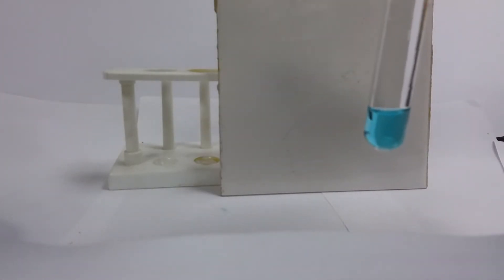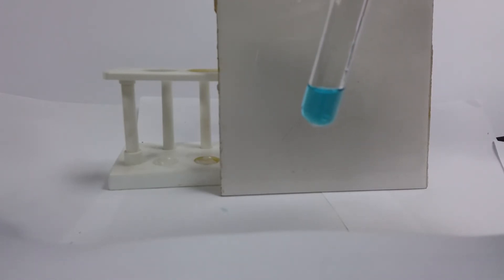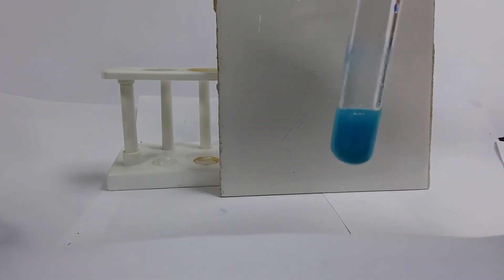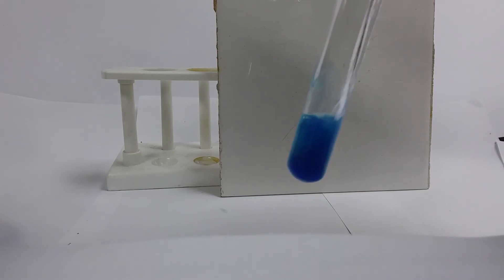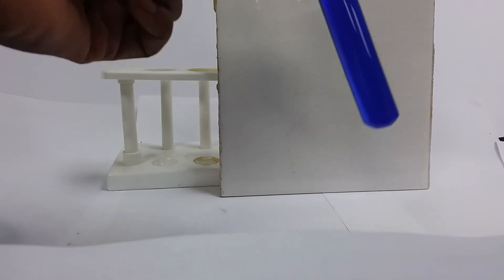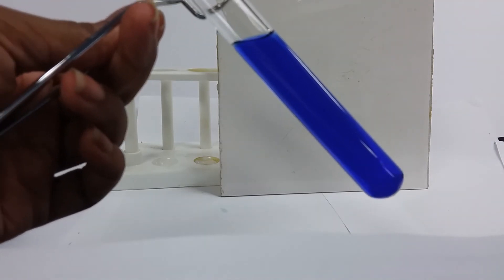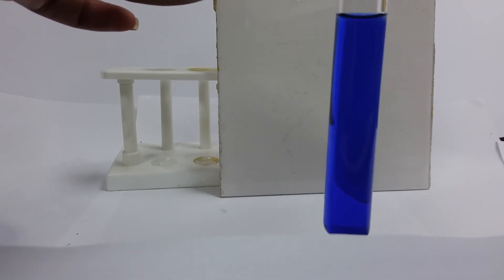Next up, some aqueous ammonia. What do you expect to see? What you're seeing is a lot darker than what I'm seeing in real life — remember what it looked like at the start. That was one or two drops, and now I'm going to add aqueous ammonia in excess. Look at that. What has happened here? This looks exactly in real life as it does on the camera. What has happened to my precipitate, and how would I record that observation?